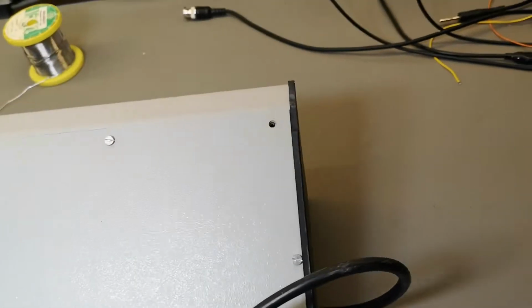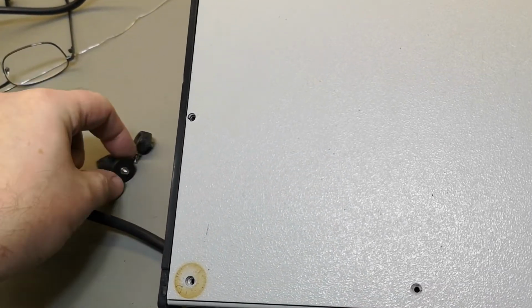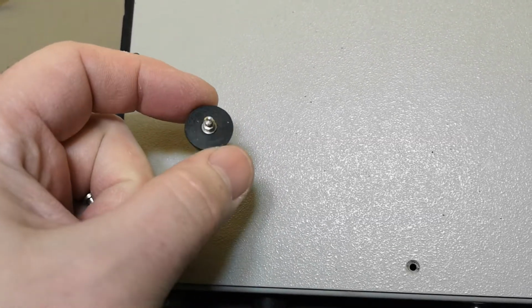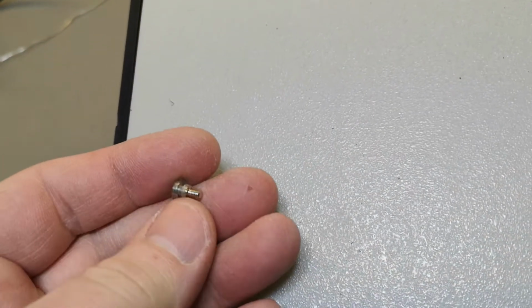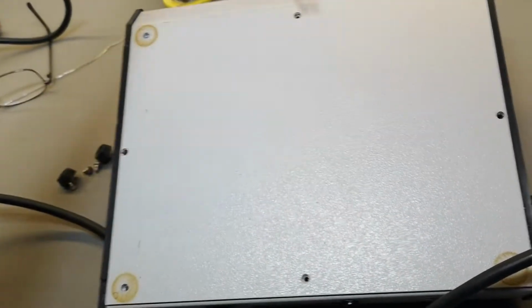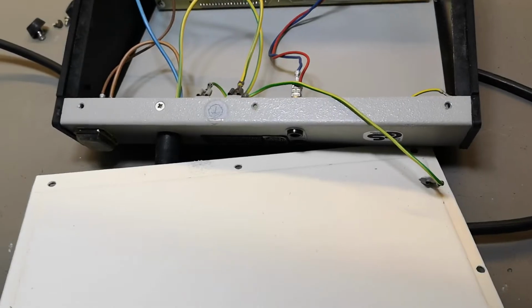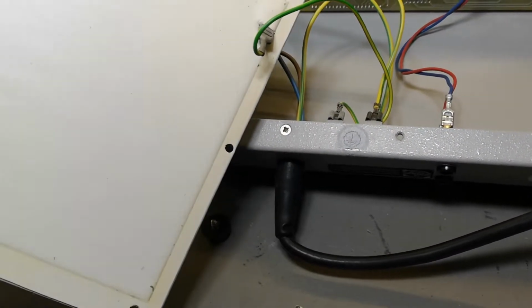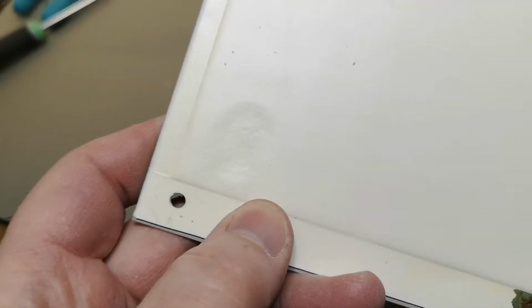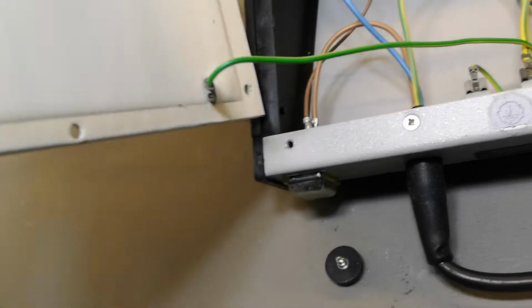It is the bottom. Huh, somebody forgot a screw. All right, I go and find a screwdriver. Don't you just love it when they're using specially designed screws for the task? So all screws are specially made. How cool is that? Oh, why didn't that open? Okay. That is nice. Oh, and this is some foam. It's soft, see? When I touch it, some soft, sticky, fantastic foam.